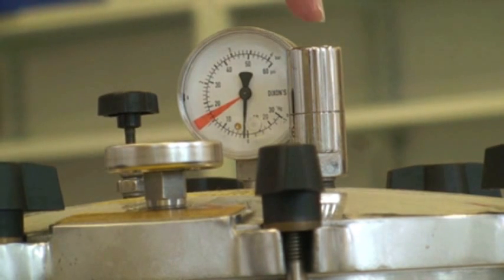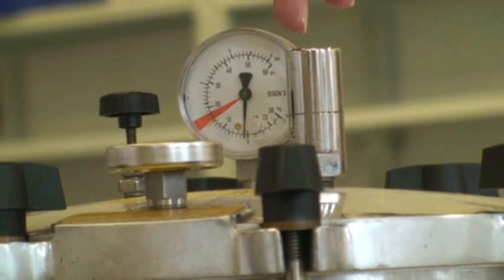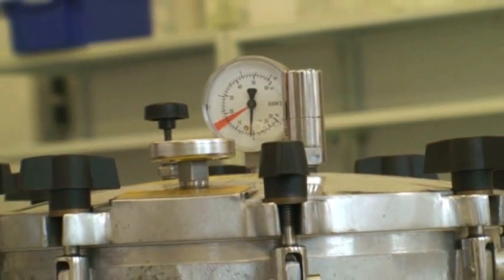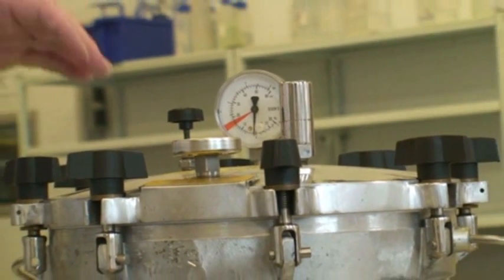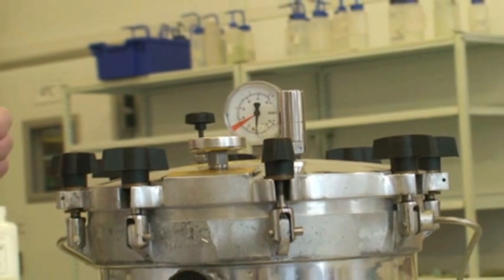Once you hear the steam coming out of this gauge, you can commence timing of your 15 minute 121 cycle.